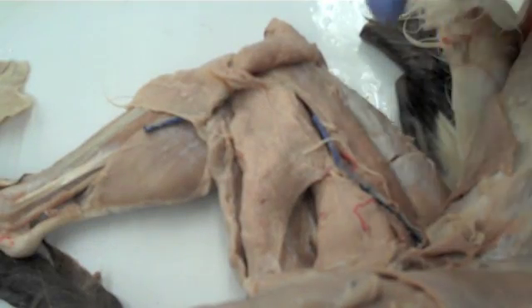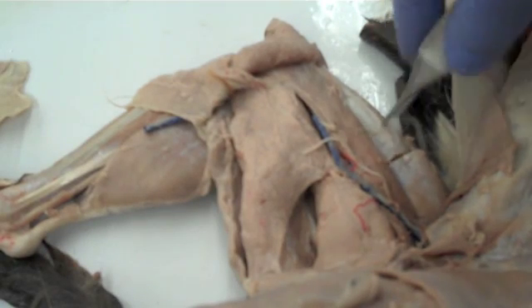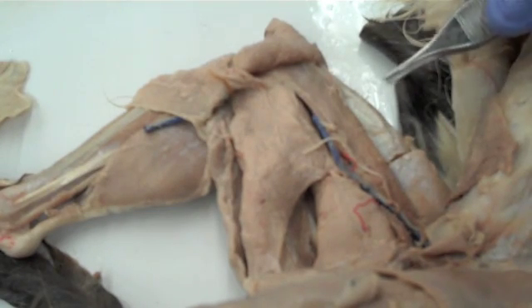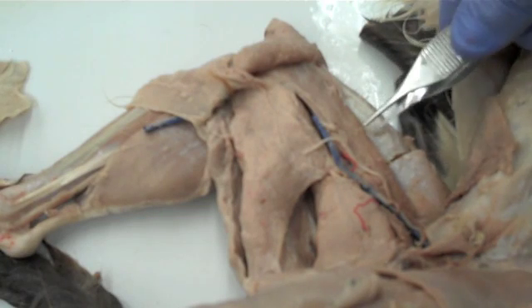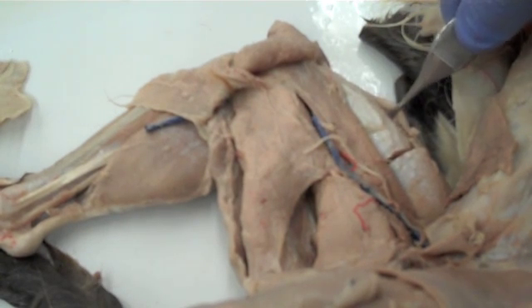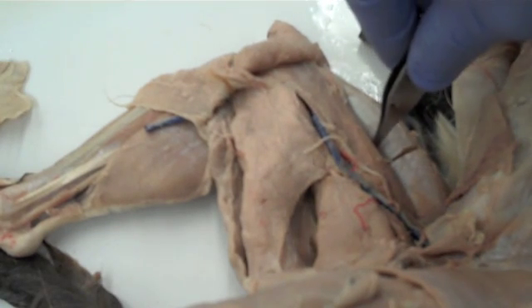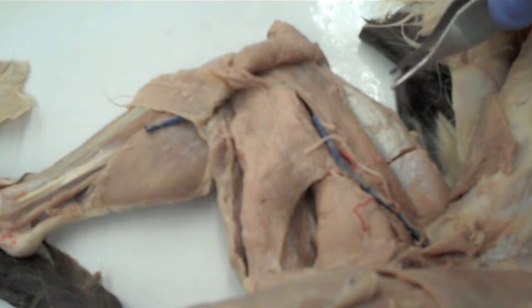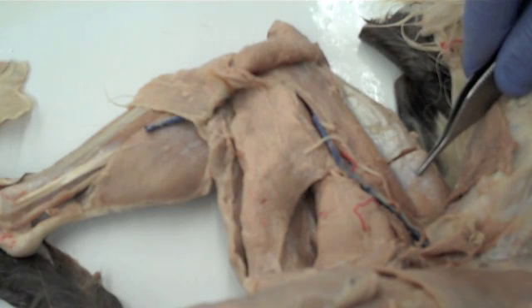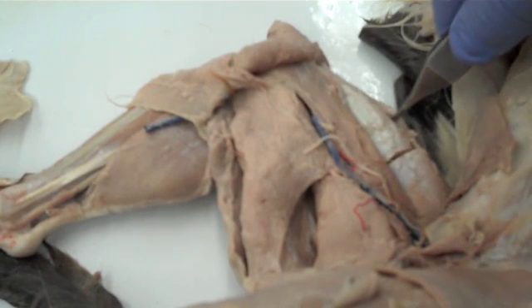Up here in the quadriceps group, we have the central muscle known as the rectus femoris right there — it's covered in a shiny white fascia. Surrounding the rectus femoris are three other muscles, all called the vastus muscles: the vastus medialis, the vastus lateralis on the lateral side, and then underneath the rectus femoris, not visible on camera, is the vastus intermedius. So to repeat, the quadriceps are the rectus femoris and three vastus muscles — the medialis, the intermedius underneath, and the lateralis to the lateral side.